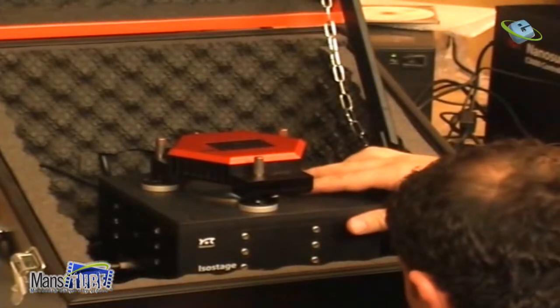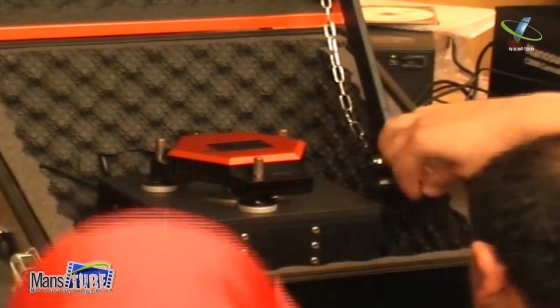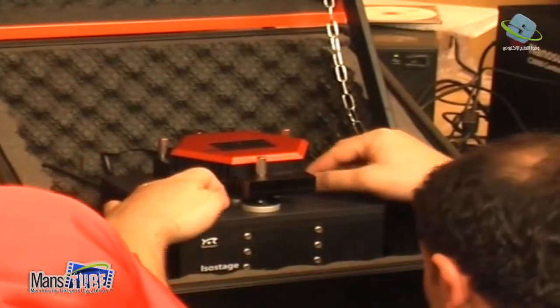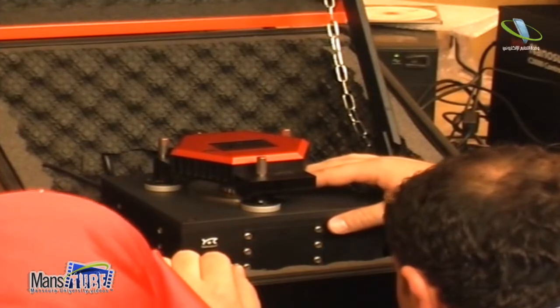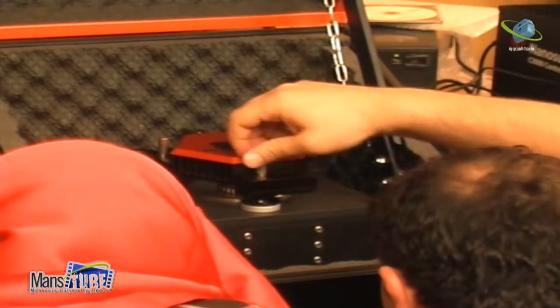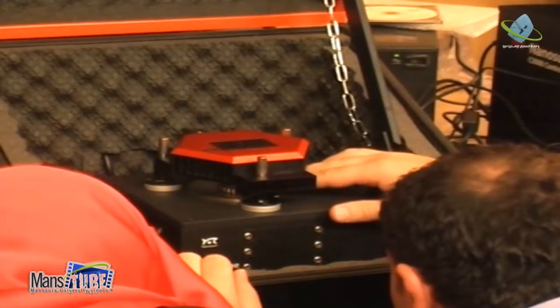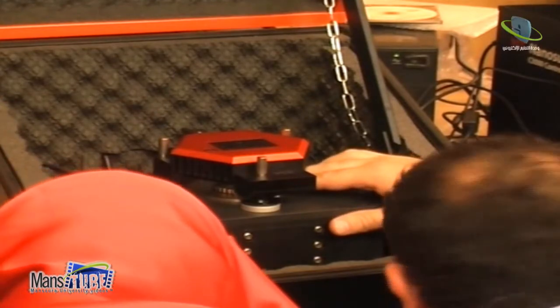And when I go here, under the liquid, you see, okay, I will go under my. Okay, I will go. Maybe there is too much water. Okay, and look now. Boom. You see? Yes. See how it happened? Yes. Okay.